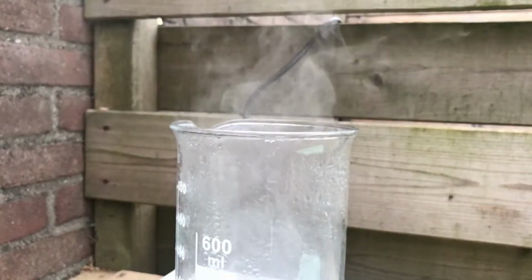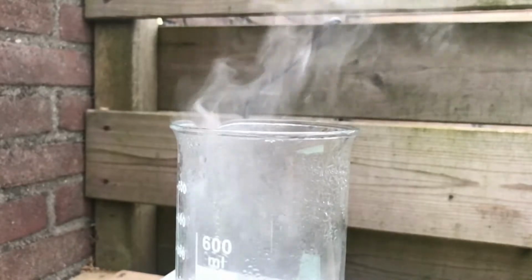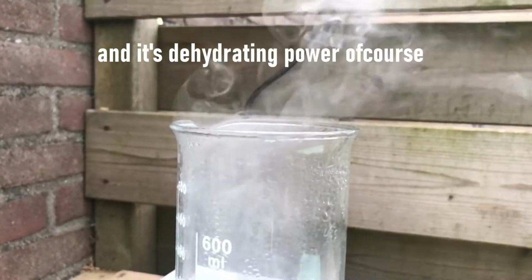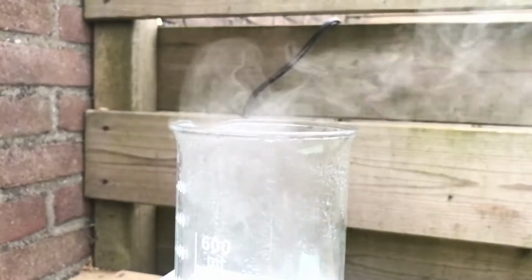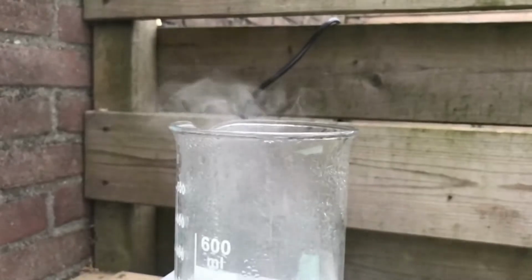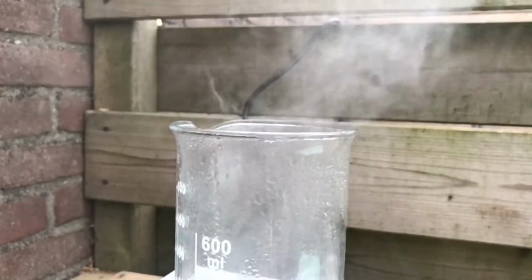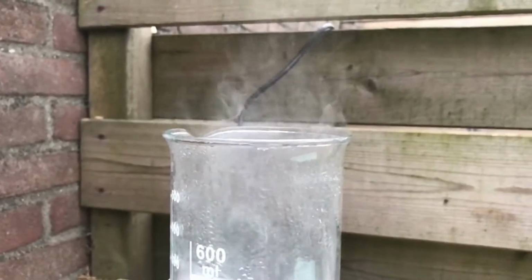Sulfuric acid is a very useful acid because of its high boiling point and high acidity. It's a very versatile chemical that was used in all sorts of reactions. But unfortunately, it's also banned in the EU. So that's why I will be exploring lots of methods to make sulfuric acid in this series.